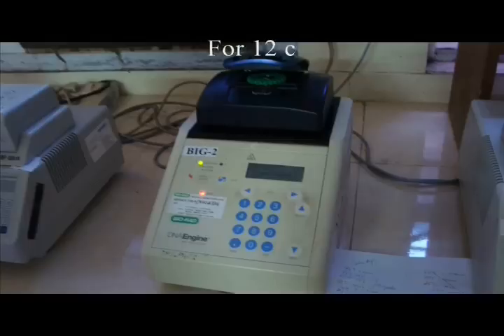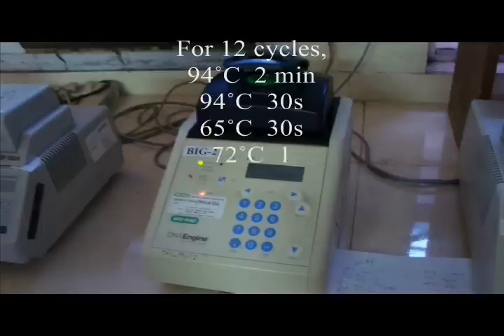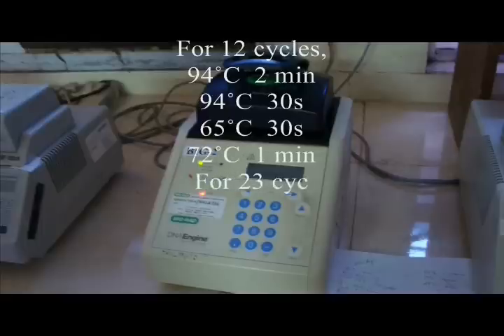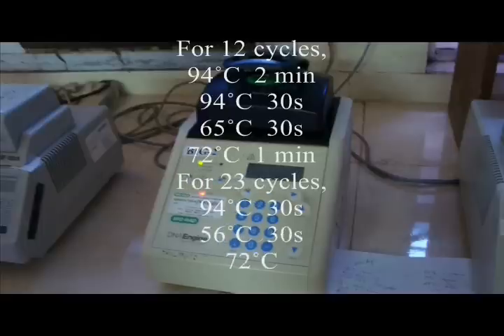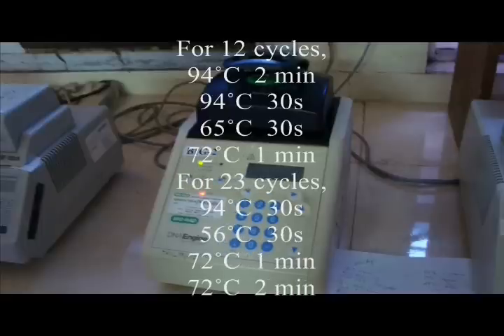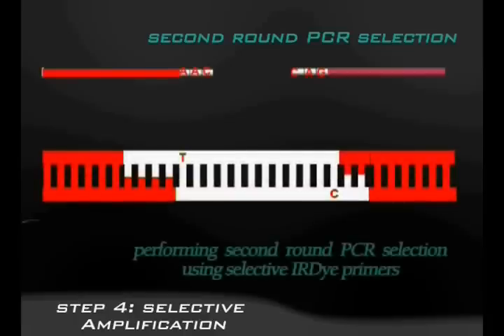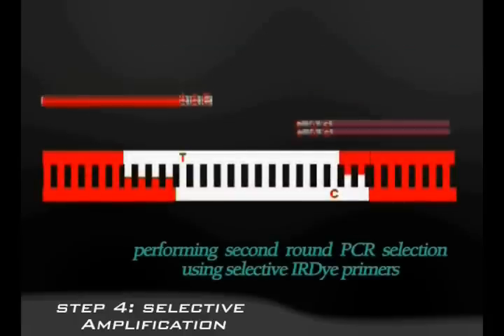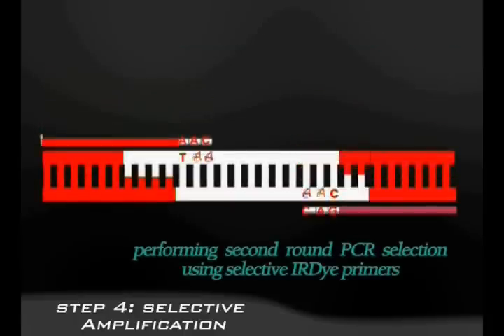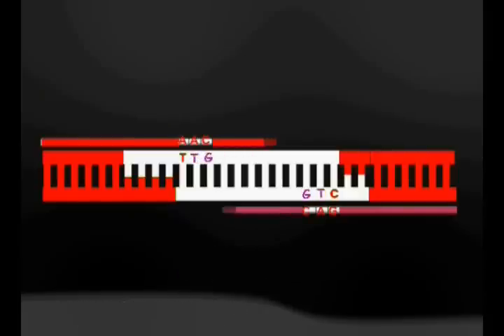The next step is selective amplification. A specific temperature profile is maintained in the PCR machine for this process. Here, additional 3 or more nucleotides are added to the primer sequence, which makes the amplification still more selective.